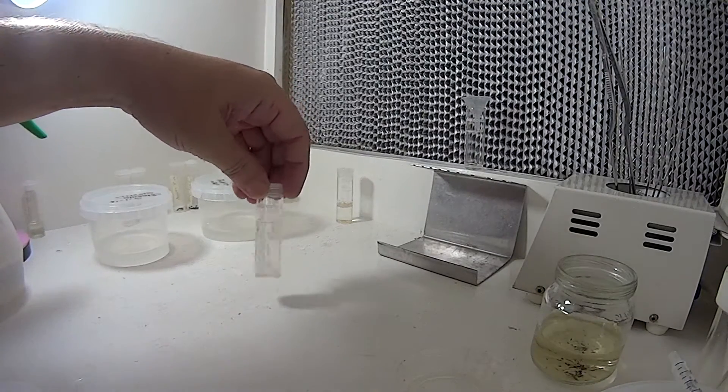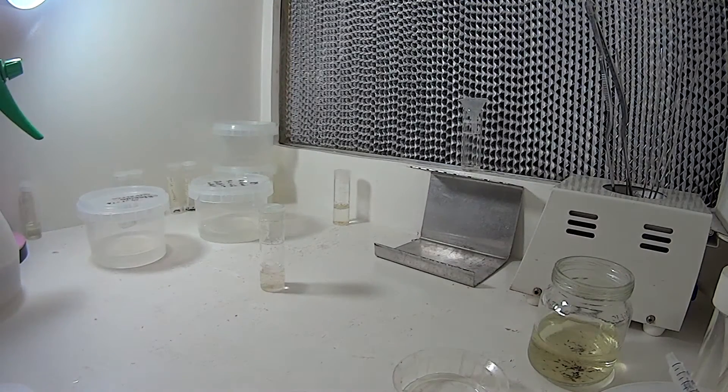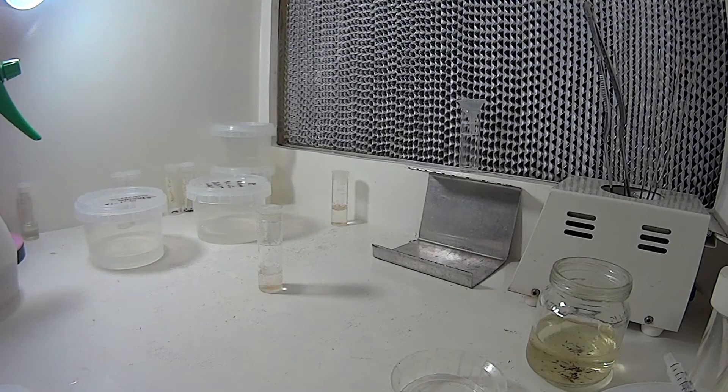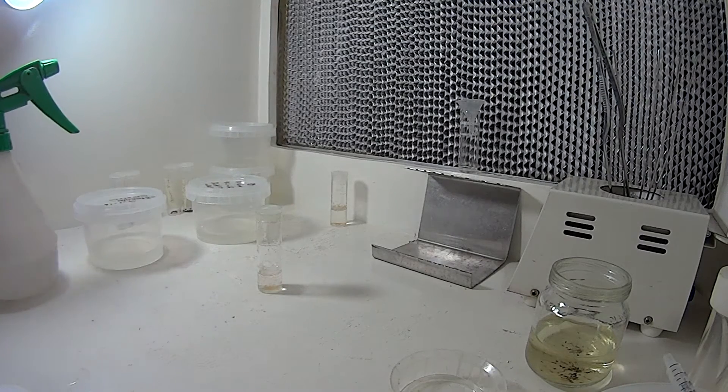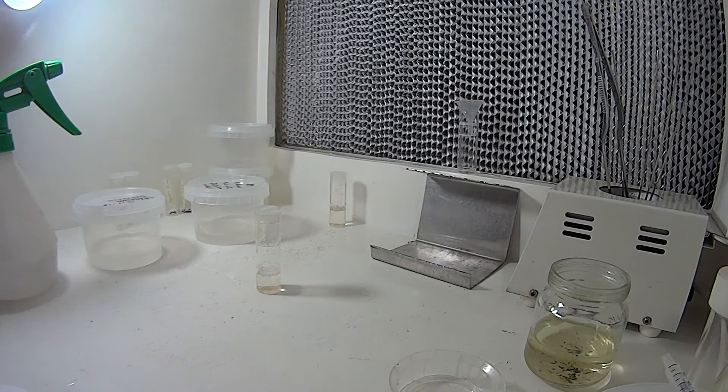I thought I'd have another go at some orchid seed. The first few attempts I had were not quite so successful. I think the sterilization was a little bit too long and we had nothing grow at all, not even any contamination so that was probably a good sign.